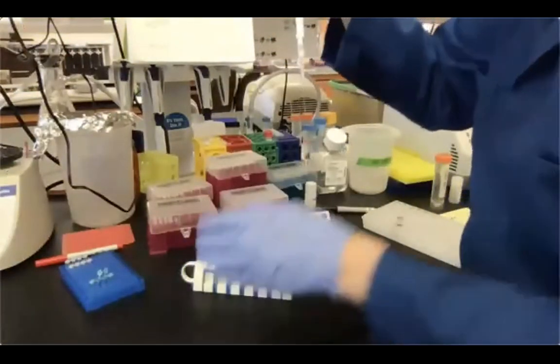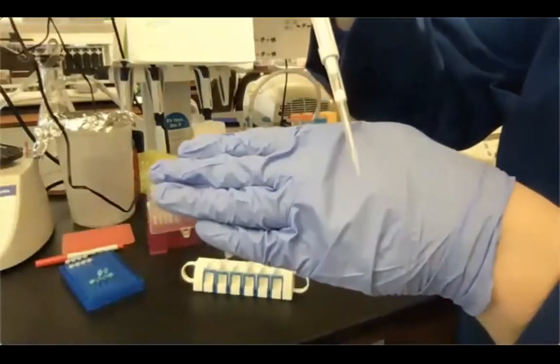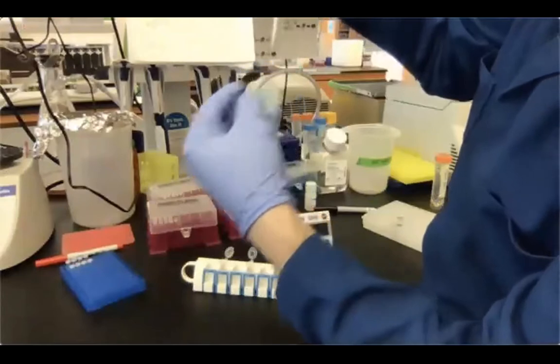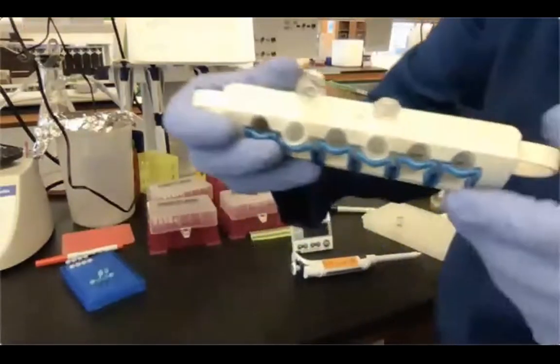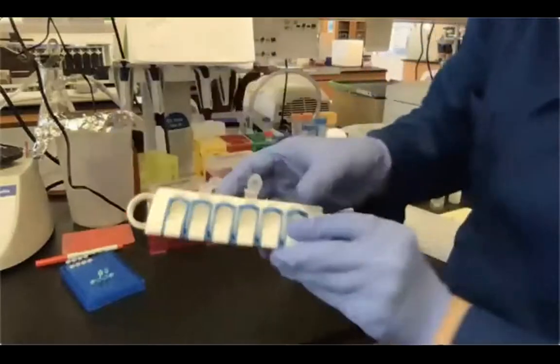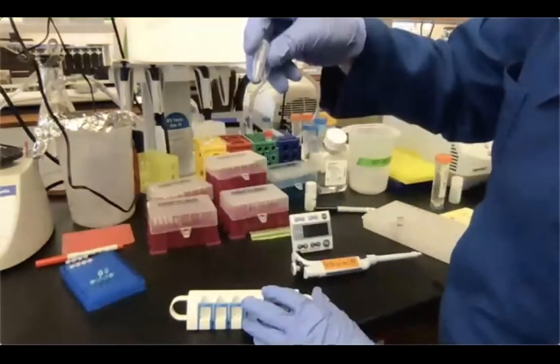Okay, as you can see, no beads carry over. In this case, this is not supernatant to be discarded. This is just our purified DNA library. So I'm just gonna pipette this in here. You can still see the bead pellet here and here, and we can discard these tubes because they don't have anything bound to it.